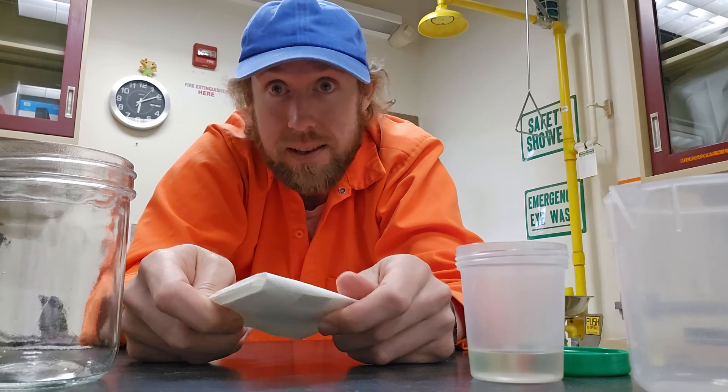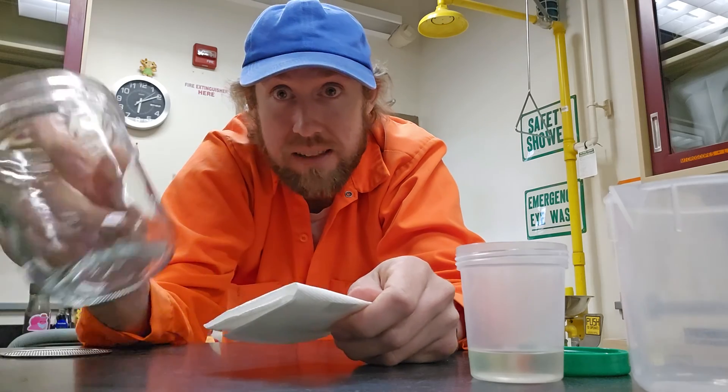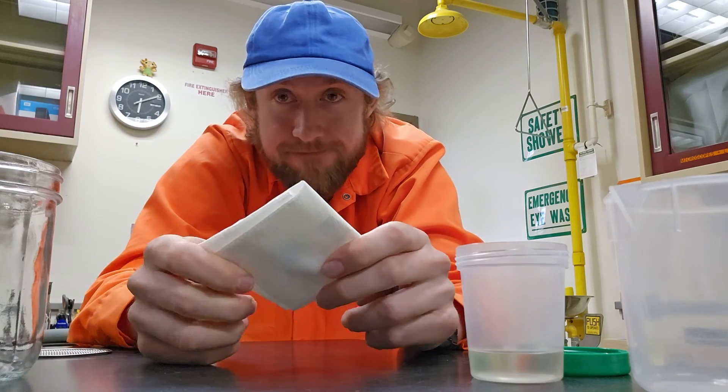And that's it. How much easier is that compared to washing and drying and blow drying in a jar and all that. Goodbye.